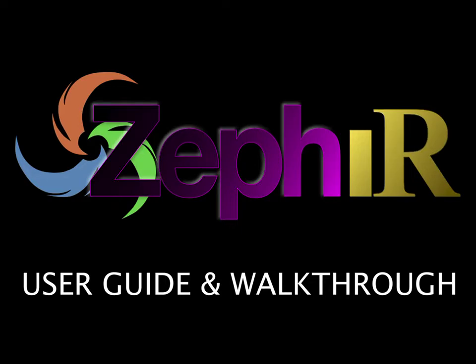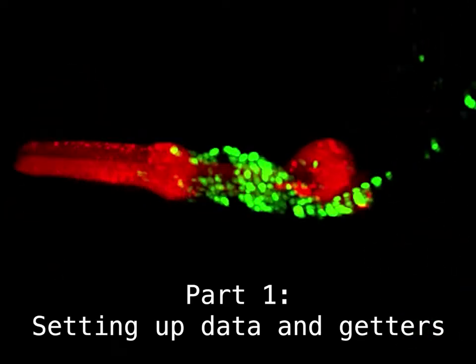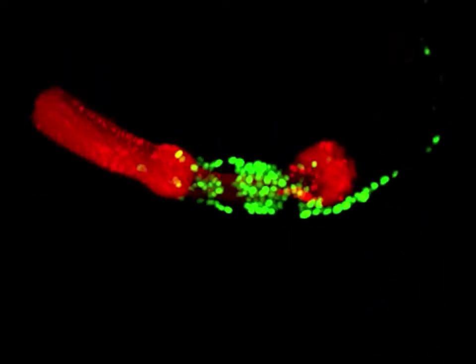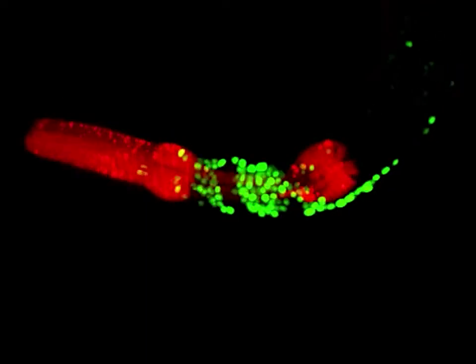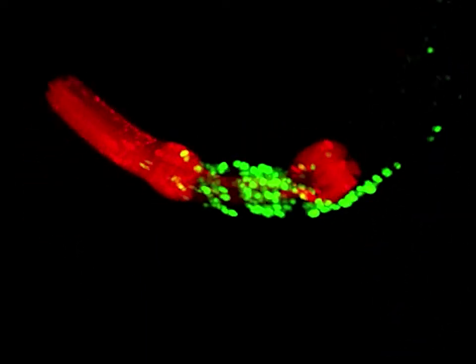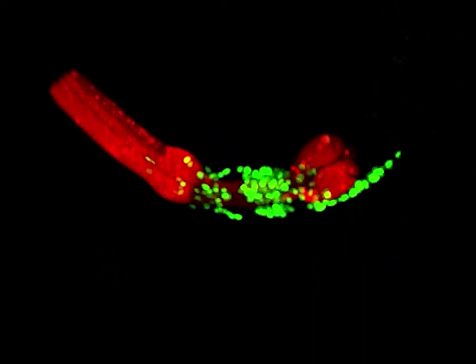We will be going through the steps to track new key points in a new dataset. For this tutorial, we will be tracking fluorescent neurons in this movie of a moving C. elegans worm. Notice that we have already done some pre-processing for Zephir in this movie. For the best results, we recommend that the general region of interest be centered with a fixed orientation, like how the worm is always facing left here.